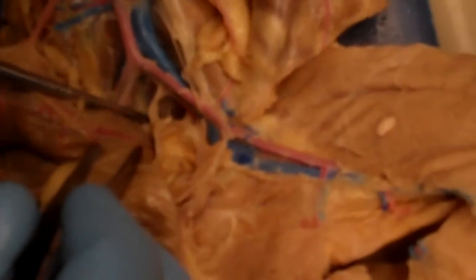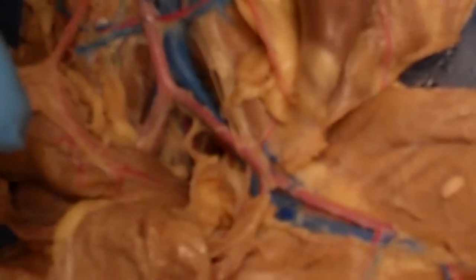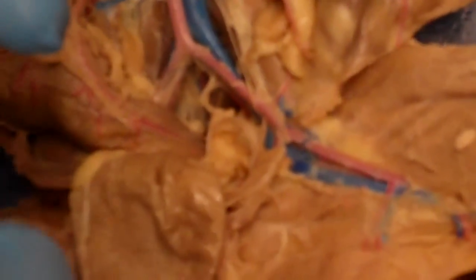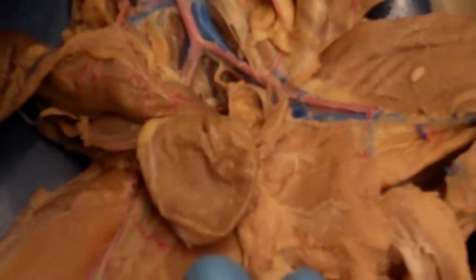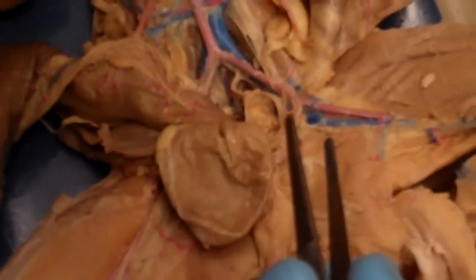And then finally, if you look right on the midline, there's one vessel called the caudal artery, which is right here. So we have the first Y, which is going to be the external iliacs, a smaller Y, which is going to be the internal iliacs, and then finally one lone little vessel is going to come out as the caudal artery. And the caudal artery is just going to go do the tail. And people, obviously, we don't have the tail, so it just sort of terminates on our coccyx, which is our tailbone. And those are sort of the main branches coming out.